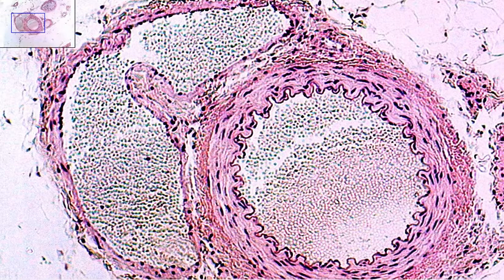So if we go over here, this structure is the vein. Now we still have the tunica intima, this thin little inside line. We have a very thin layer of the tunica media, the smooth muscle, and then a little bit of the tunica externa running around the outside here. So all three tunics are still present, just in different proportions.